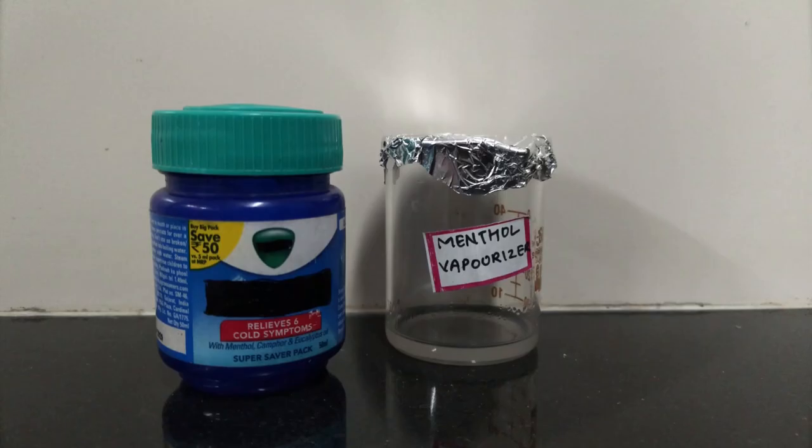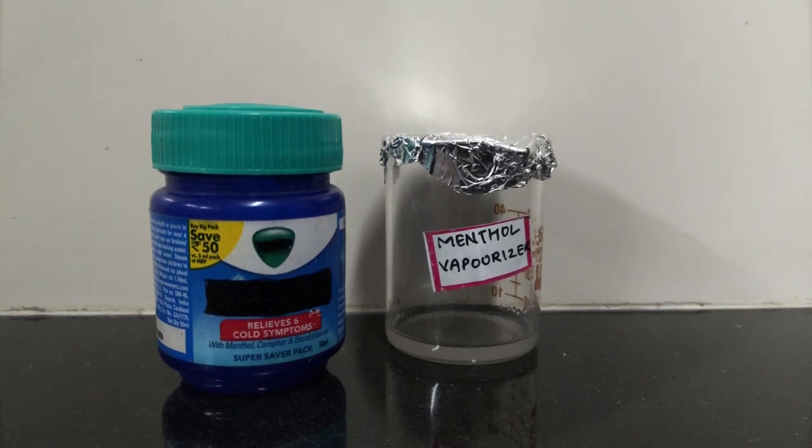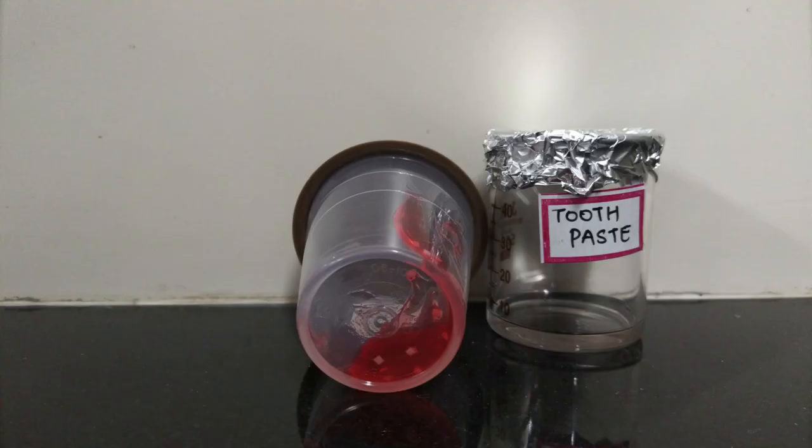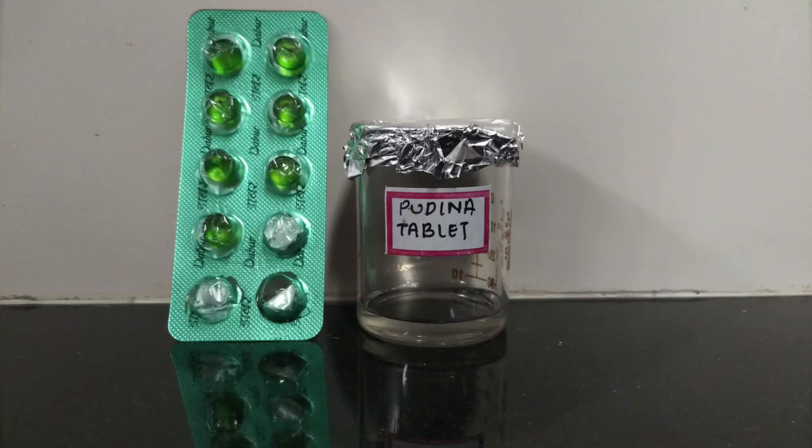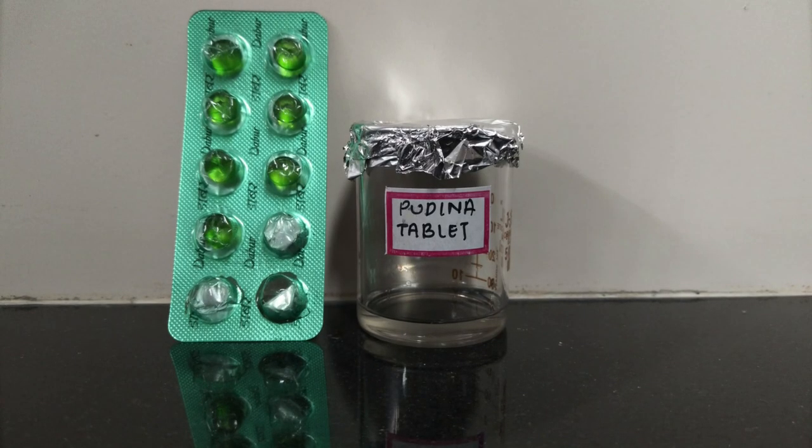The samples used for this experiment are mint leaves, menthol vaporizer, mint oil, toothpaste, ointment, pudhina tablet, and mouthwash. These samples were extracted using ethanol.